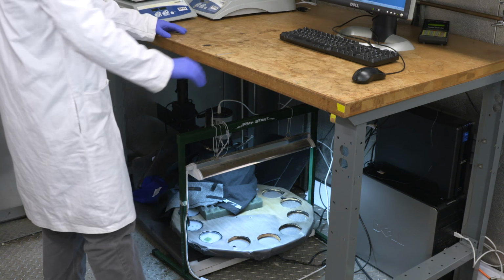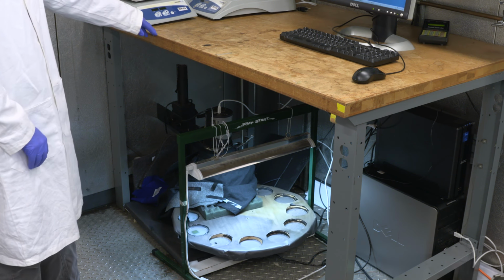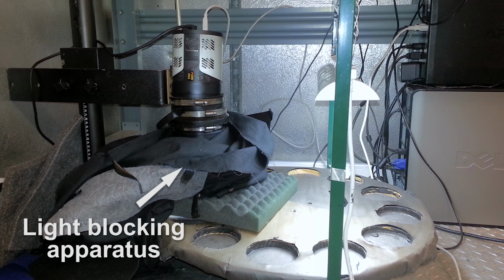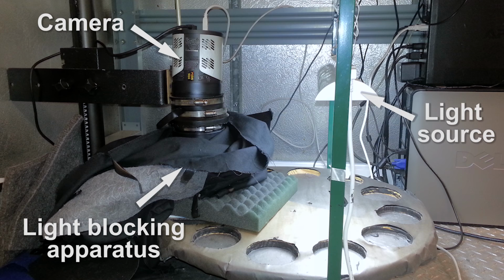Once every 2 hours, the table will rotate each plate under a CCD camera to be imaged. You can see that the plate that is being imaged by the camera is covered and is kept in the dark so the weak amount of light produced by the bacteria can be detected by the camera. This is important because otherwise, the camera will measure light from the external light source, which we have placed over the bacteria, and the bioluminescent signal will be lost to ambient light noise.